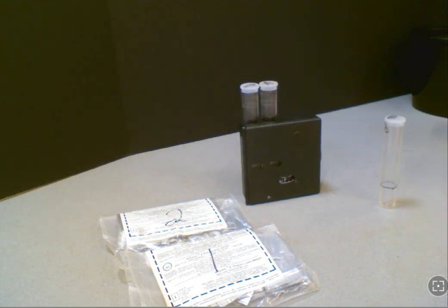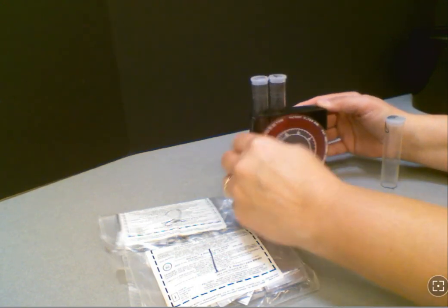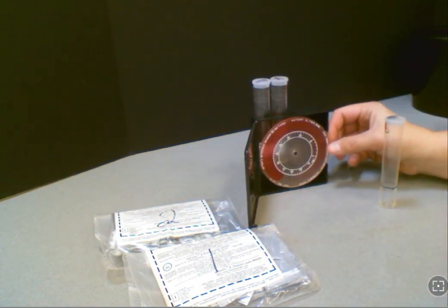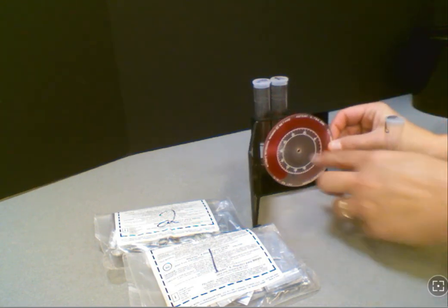In your test kit you're going to find two chemicals you're going to be using along with another color comparator and some sample tubes. It's important to remember the color comparator this time, compared to maybe some of your other kits, is pink and it also does not require light from above to get your test accurate.